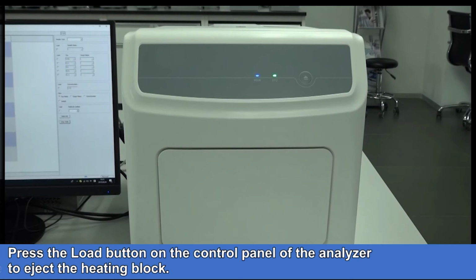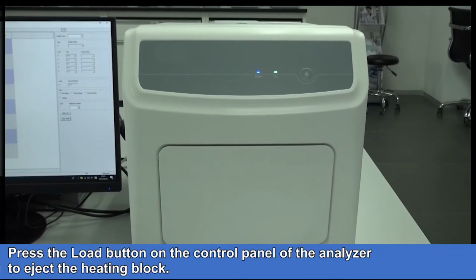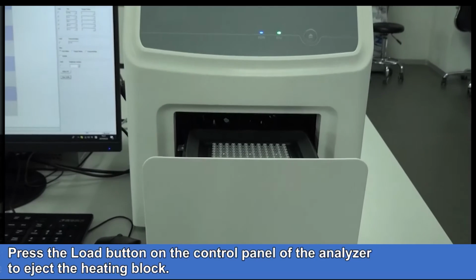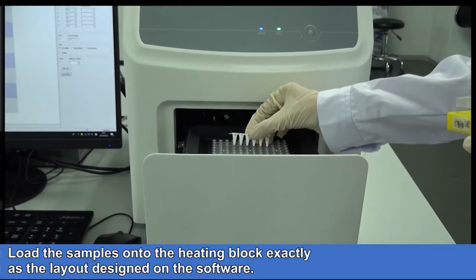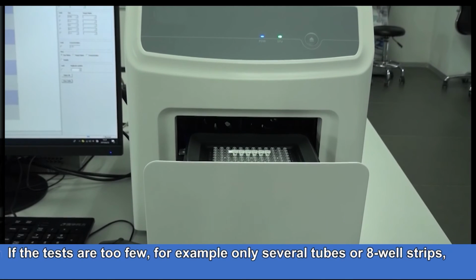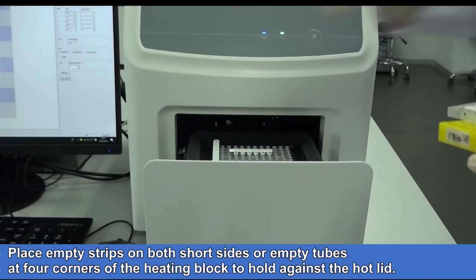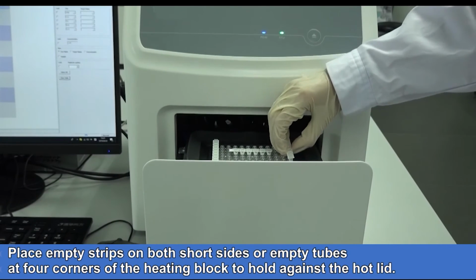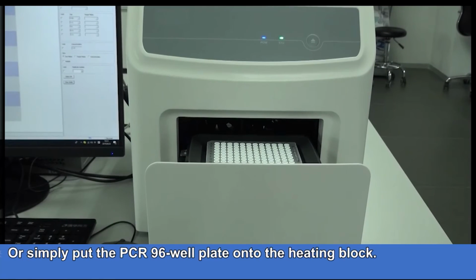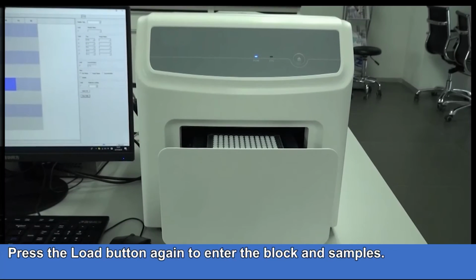Load the sample. Press the Load button on the control panel of the analyzer to eject the heating block. Load the samples onto the heating block exactly as the layout designed on the software. If the tests are too few, for example only several tubes or 8 well strips, place empty strips on both short sides or empty tubes at 4 corners of the heating block to hold against the hot lid. Or simply put the PCR 96 well plate onto the heating block. Press the load button again to enter the block and samples.